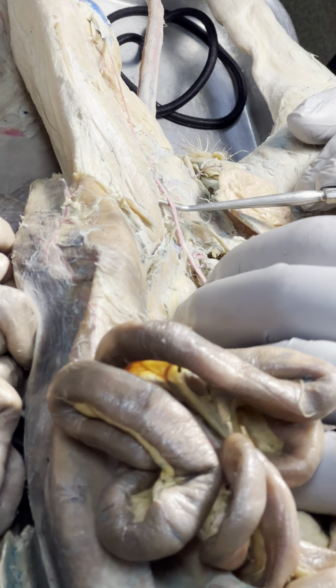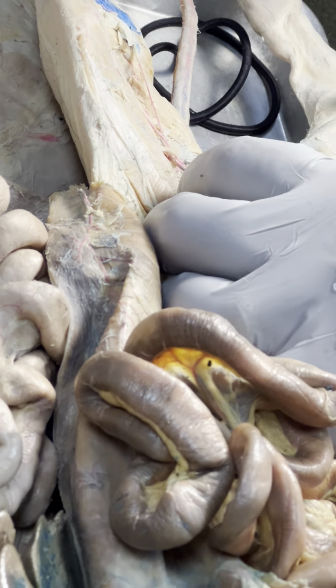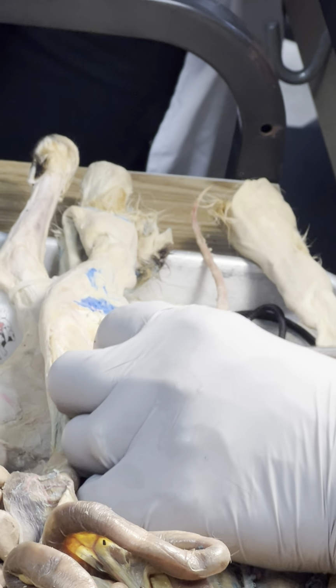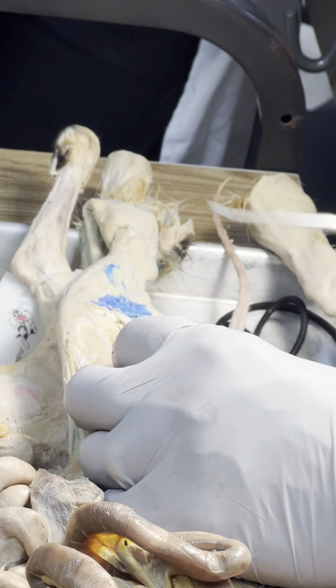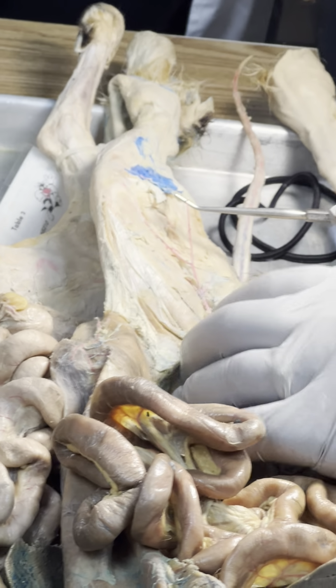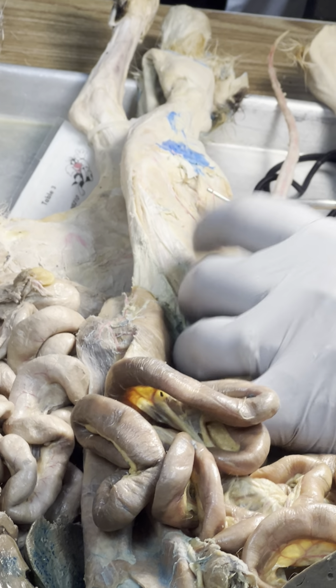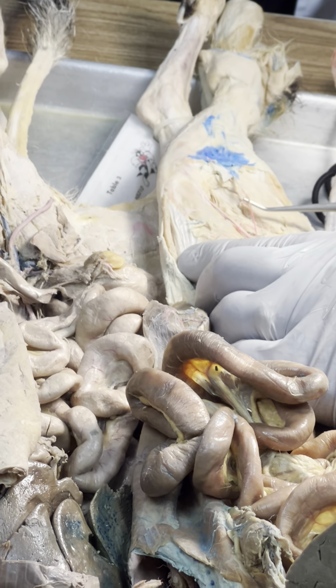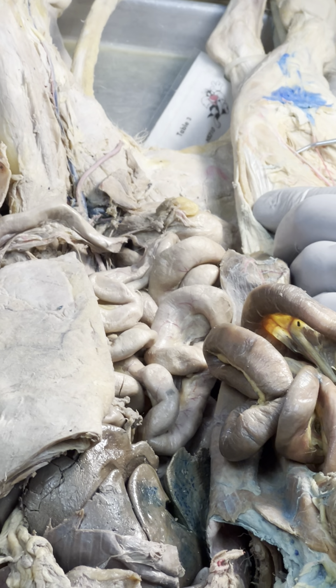This is the femoral. You won't see a pin in that one, but you will see a pin in the vessels that come off of it. Why is that saphenous? Because it's continuing all the way down the leg. It will disappear underneath the vein, by the way, the saphenous vein that accompanies it, because the saphenous vein will be larger. And we leave it alone so it don't break.